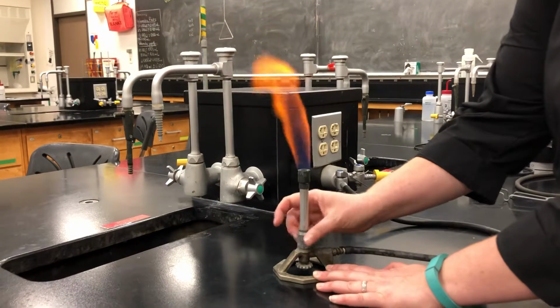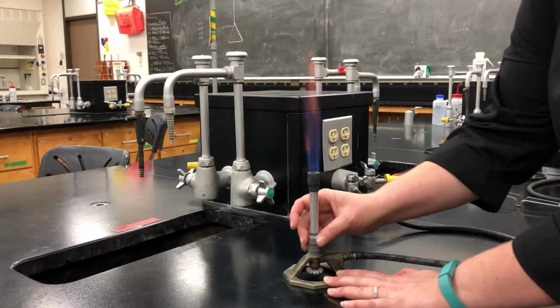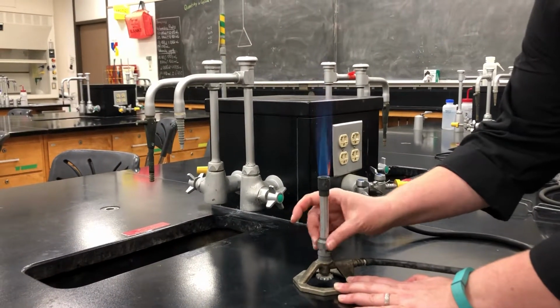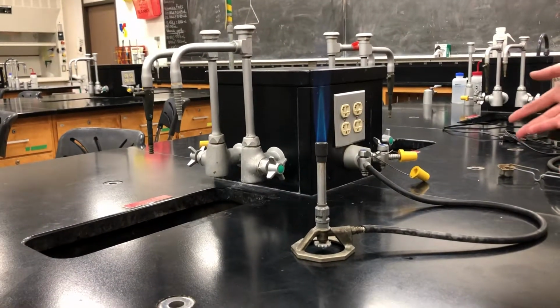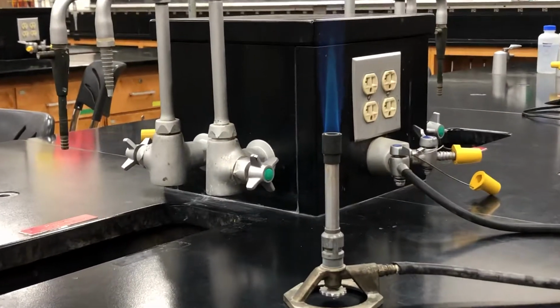so that we end up with a blue cone and a smaller blue cone in the middle. So that looks like a good colored flame. We have a blue outer cone, a lighter blue inner cone, but it's a bigger flame than what we need.